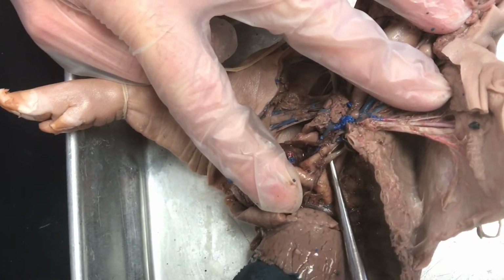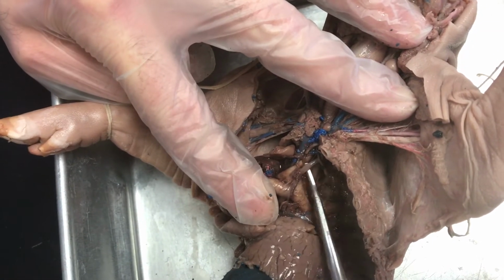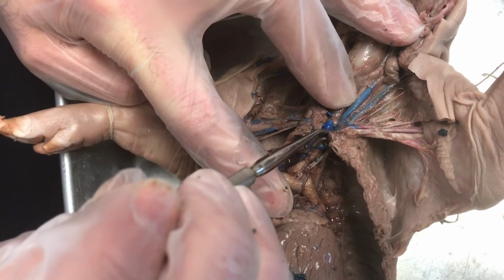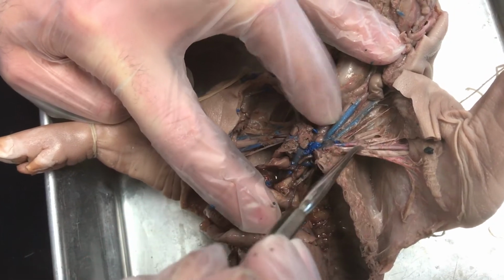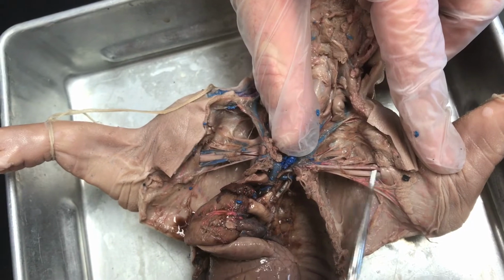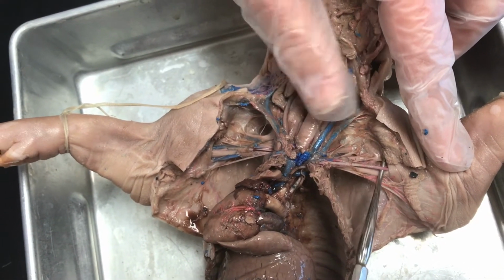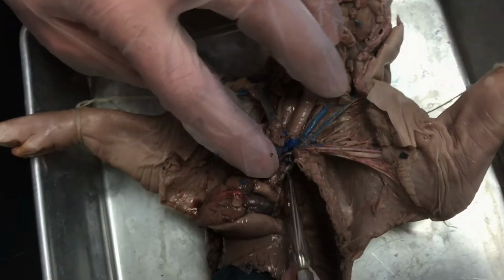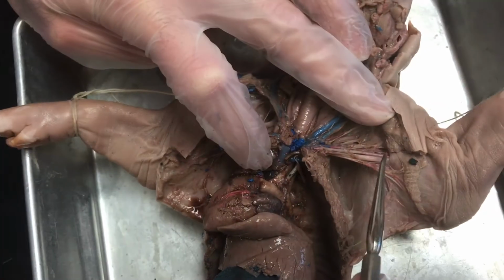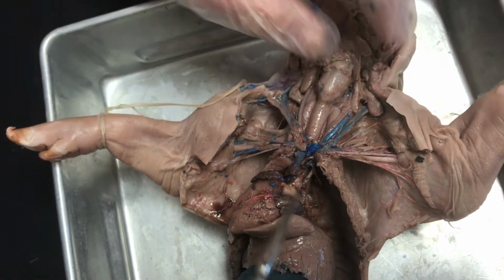This first branch is the subclavian, and that subclavian, it's a little bit hard to see, but it actually comes kind of around the rib cage here, and eventually goes to the arm, and in the upper arm, it's the brachial. So on a test situation, I'd try to make this very obvious. So if the pin is way down here coming out of the aorta, that would be subclavian. And if I wanted you to say brachial, then I'd put it way over here, so it's really obvious.